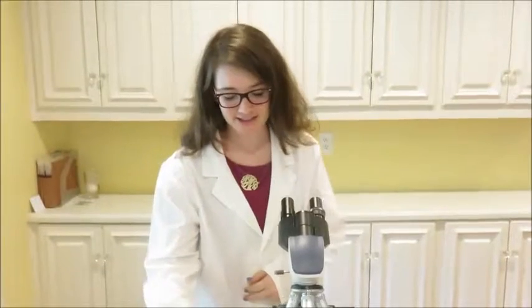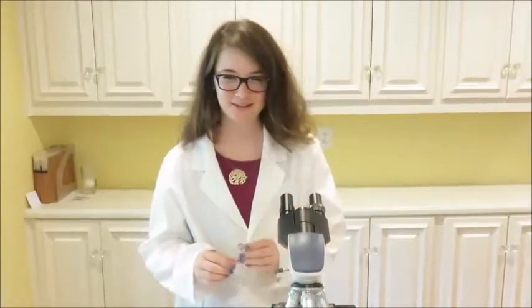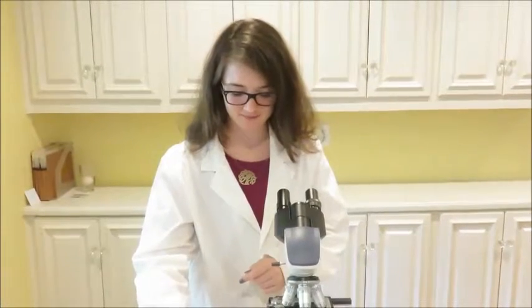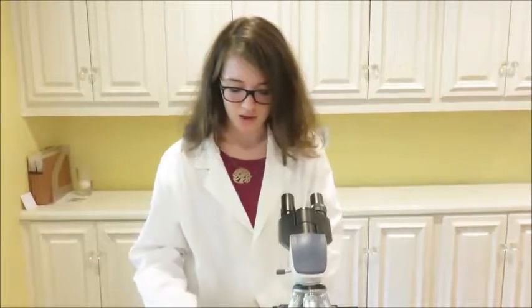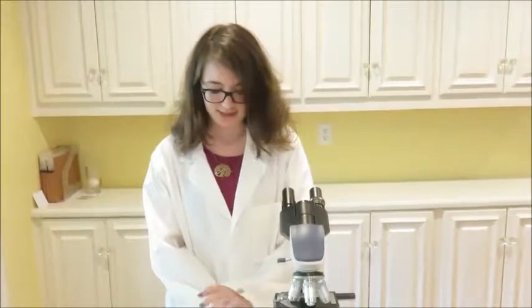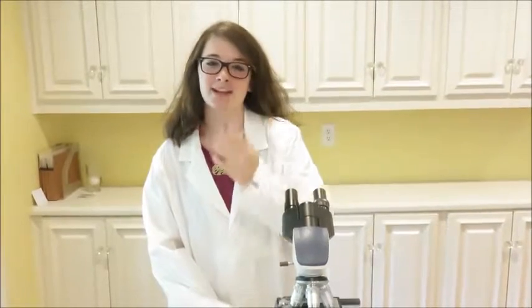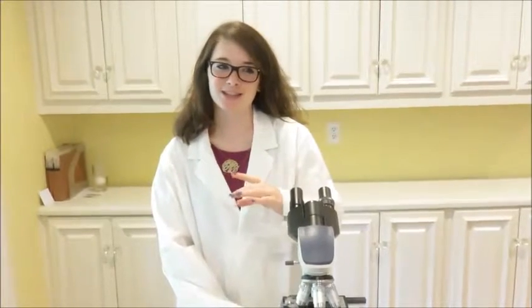So the next slide in our set, slide number 4, is the pinworm, which is a really, really disgusting parasite. Pinworms feed on intestinal bacteria and other intestinal contents. And females will lay thousands of eggs in their lifetime, and she actually just leaves a trail of eggs wherever she goes.